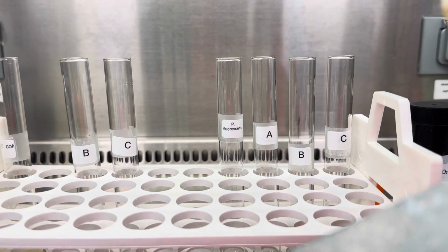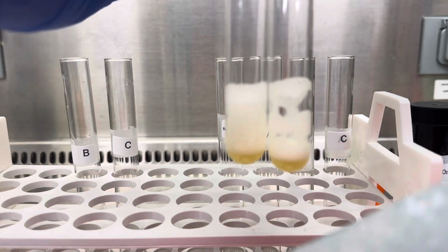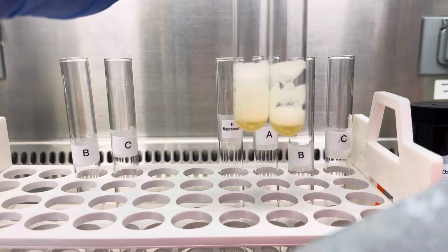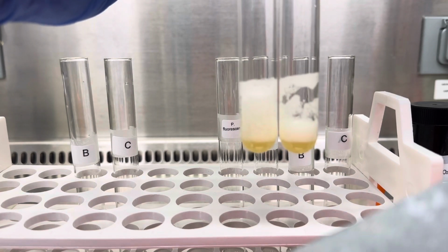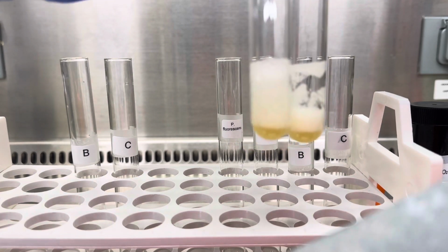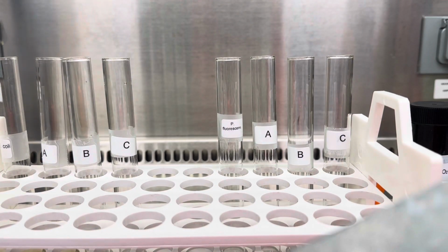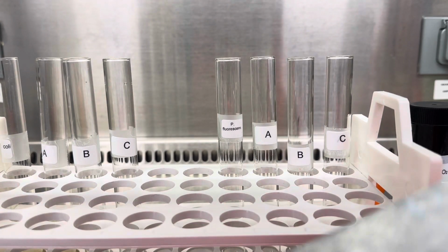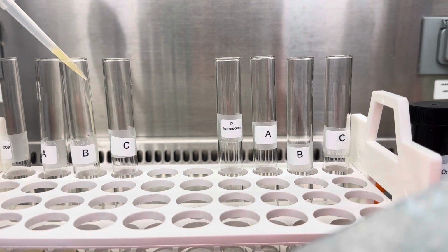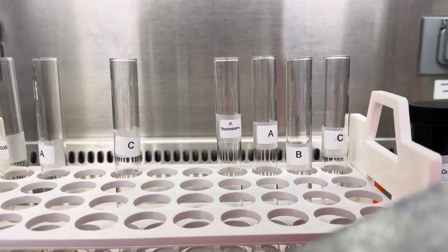Vortex this for a few seconds, and as you guys can see again here, compared to the E. coli one, they're both quite bubbly. So there's a lot of oxygen bubbles generated. So I would think personally that A would be catalase positive like E. coli, okay? Now we're gonna repeat the same procedure for unknown B. So B is here. I'm gonna take another 0.5 ml, 500 microliters of this, add it to the tube, vortex briefly, and see what happens.